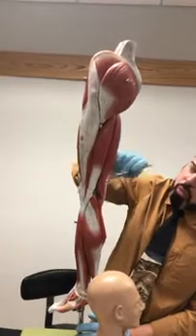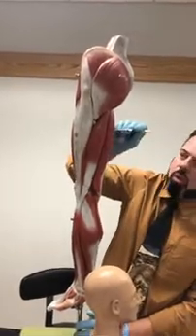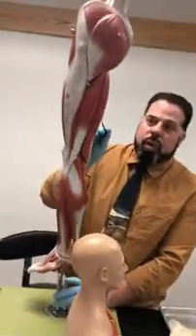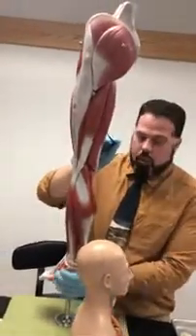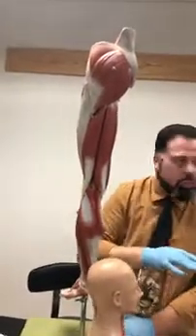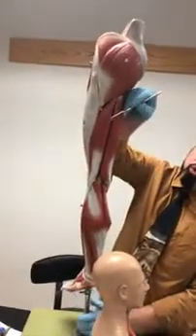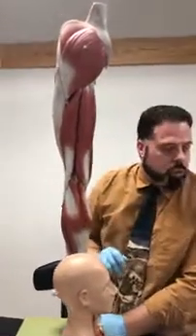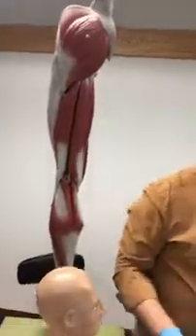And then you have, what's this one that's going to be most superficial? Semitendinosus. And the one that's found deep to that one? Semimembranosus. Think of a membrane underneath something. Okay? So there's your three hamstrings. Biceps femoris, semitendinosus, semimembranosus. Okay? So let's look at what it looks like on the cat.